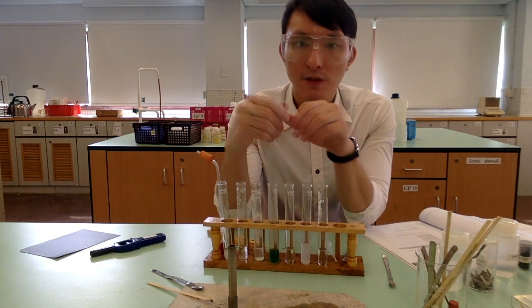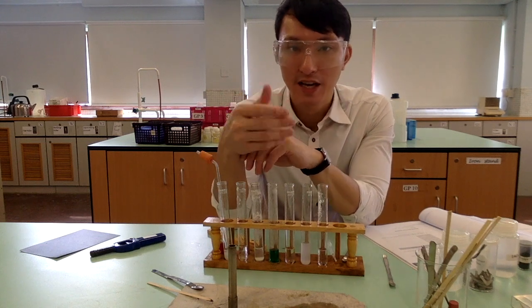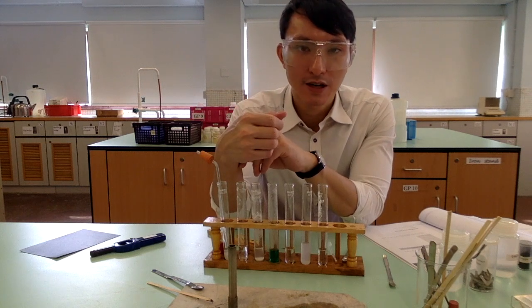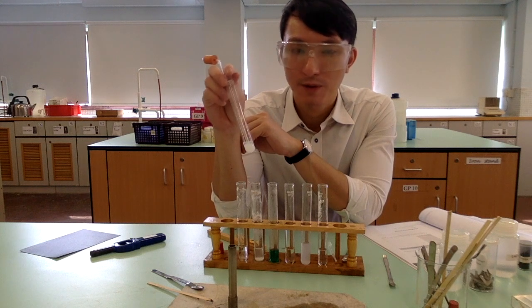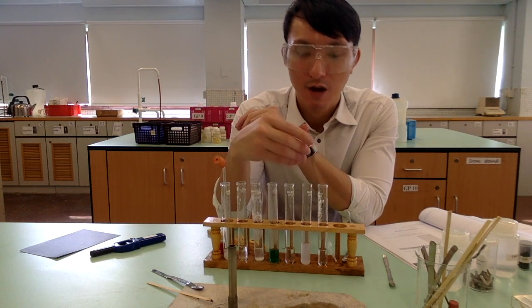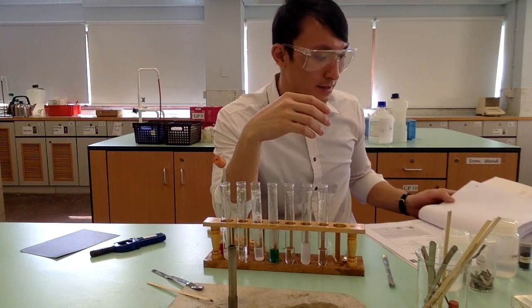Okay, and for the last series of experiments, we used a 2 test tube setup, and we studied the reaction between carbonate and acid, as well as hydrogen carbonate with acid. Both reactions generate carbon dioxide, which is shown by the lime water changing from colorless to milky. And you also see that for both reactions, bubbling occurs. Okay, so that concludes all the experiments in 14.1, and that's the end of this video.